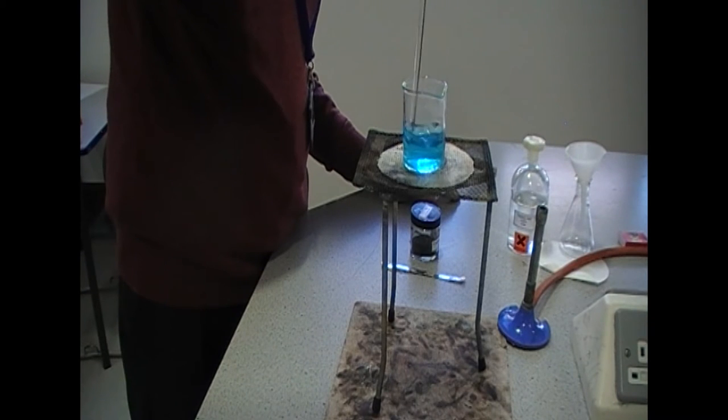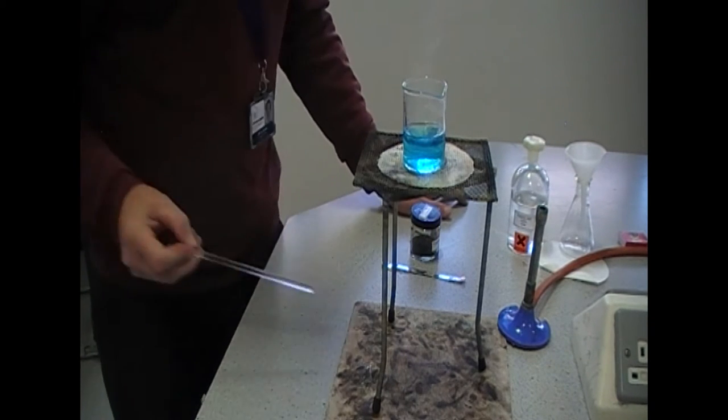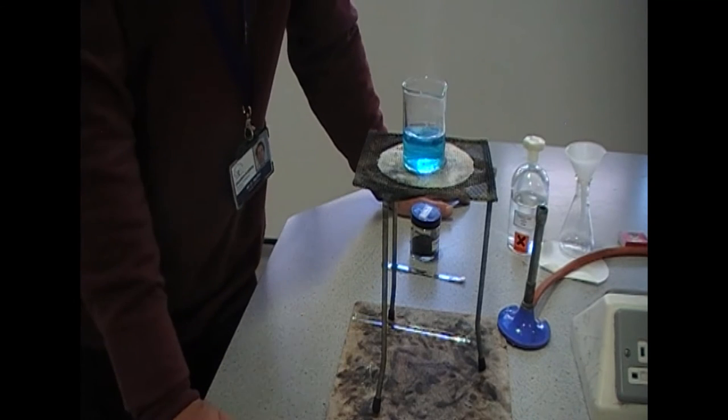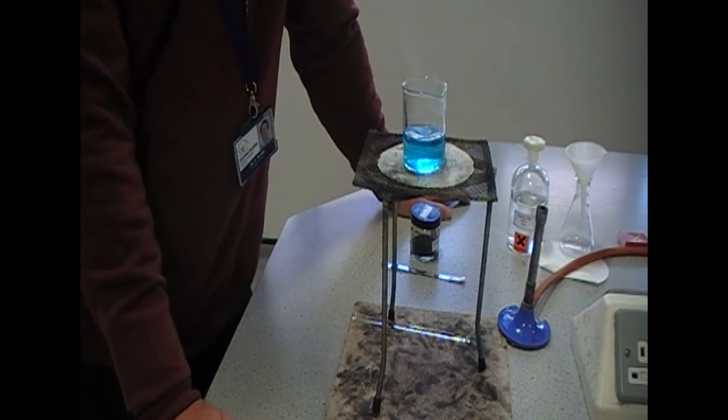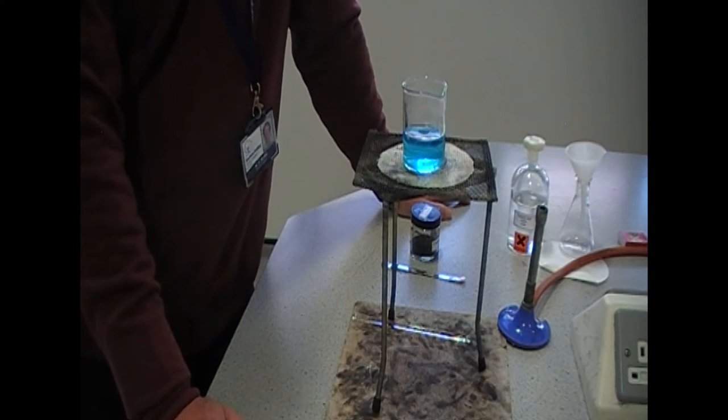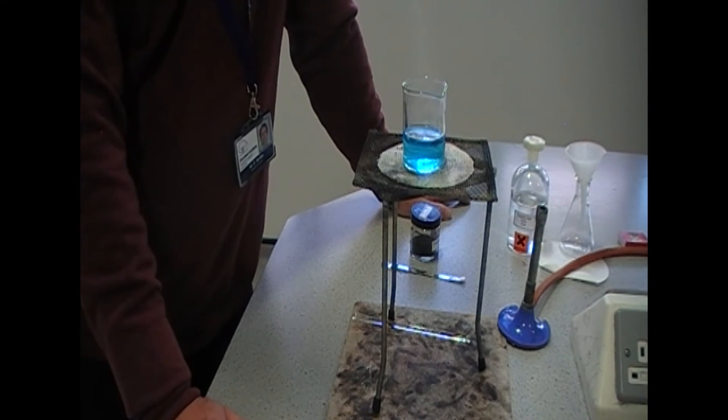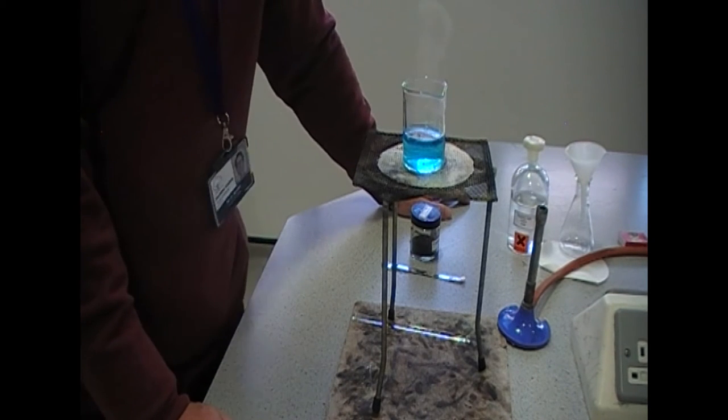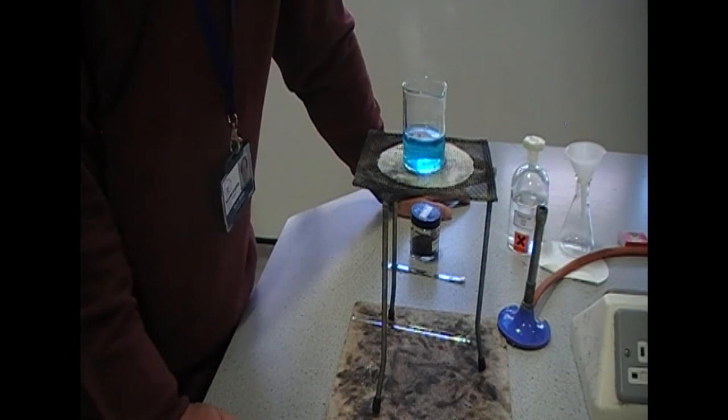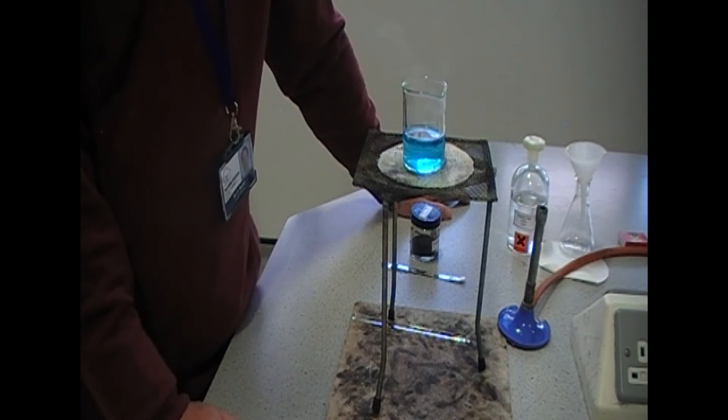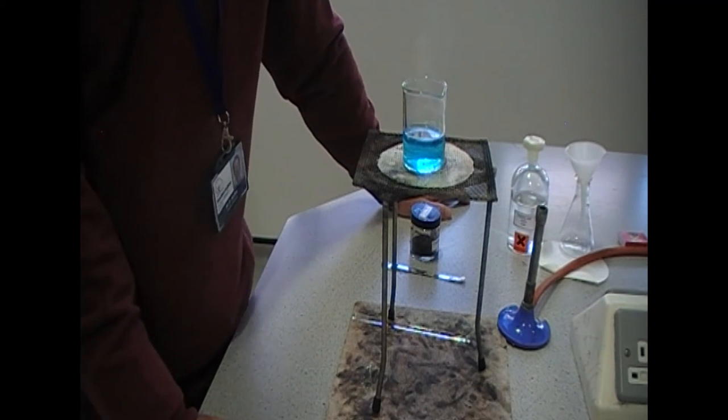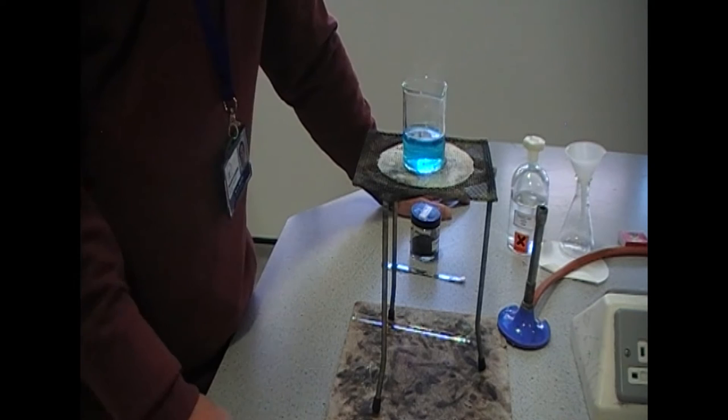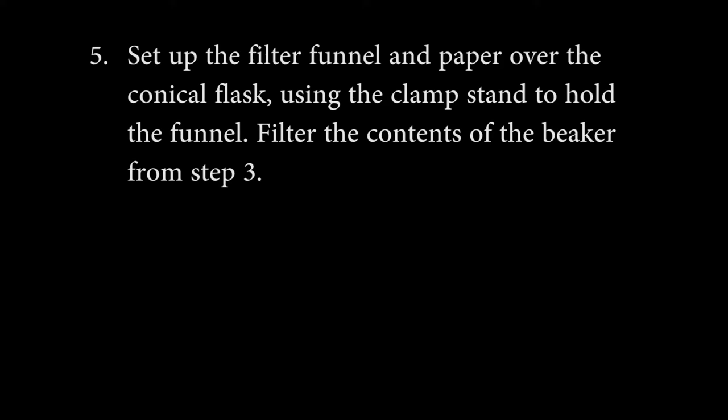All that black powder has disappeared and we would add more black powder now and stir it until, in the end, we were left with a solution of blue copper sulphate and some unreacted black stuff at the end. Which means we know that we've reacted all the acid with the insoluble base and we're left with a salt solution and some unreacted metal base. In this case, copper oxide.